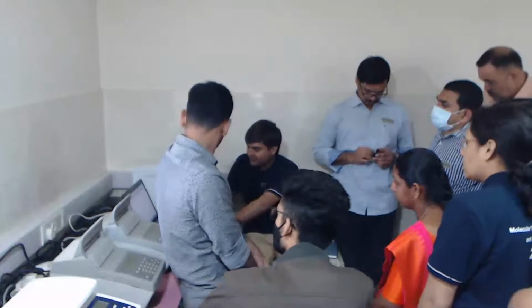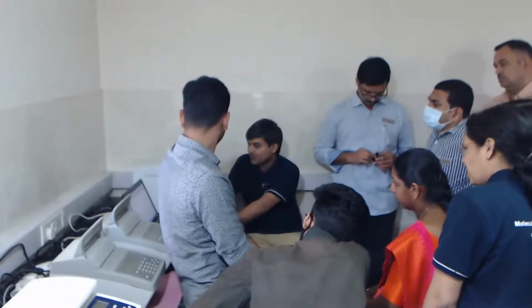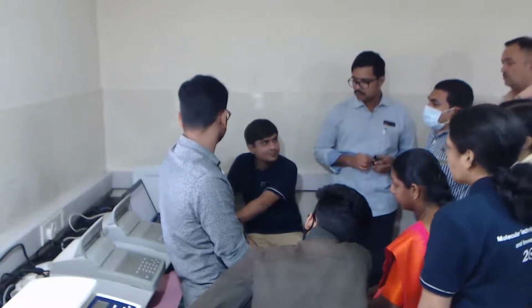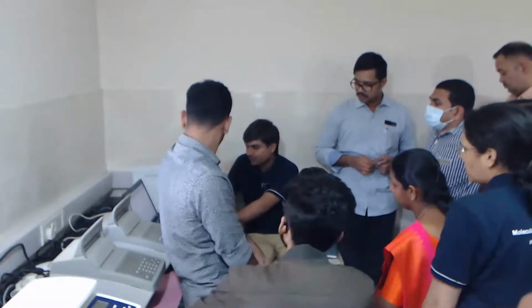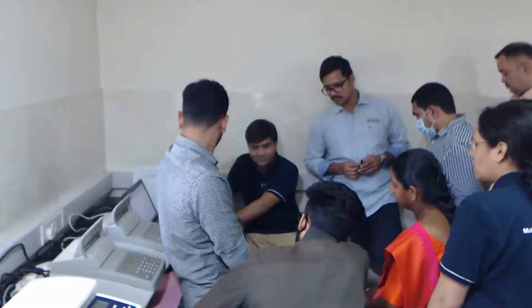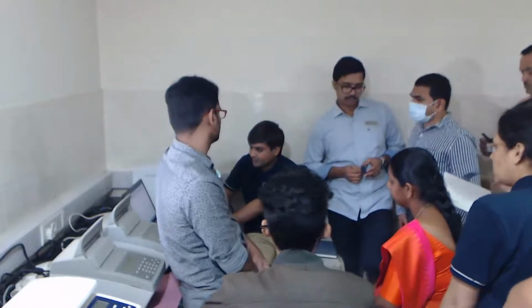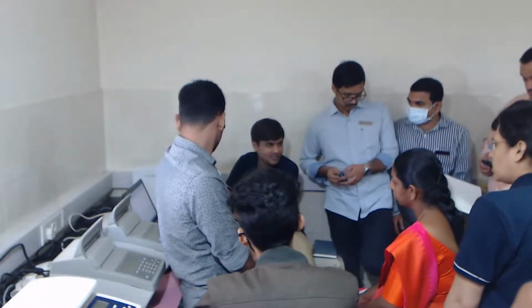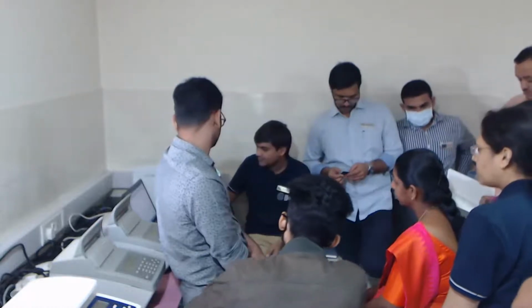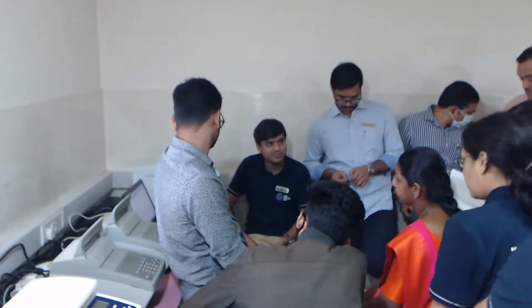One more thing that we need to take care of over here is to check for the presence of primer dimers. Most of those primer dimers will have a length around 35 to 50 bases. So we should not get any peaks near the lower marker, which is the 15 marker. All those types of quality checks can be very well performed through the bioanalyzer.